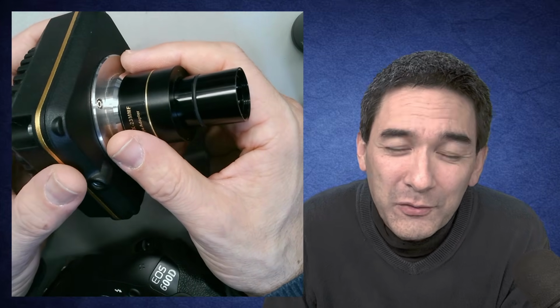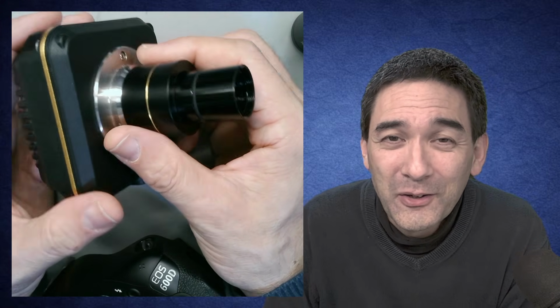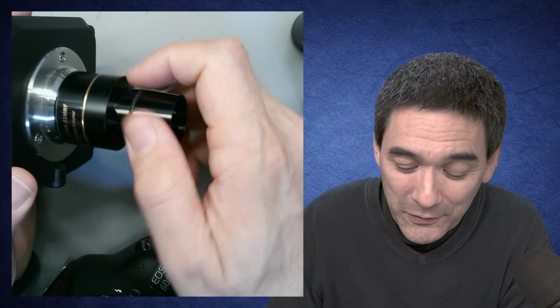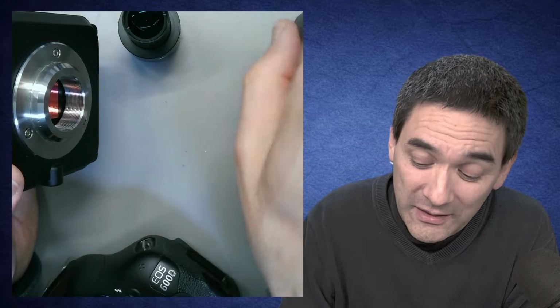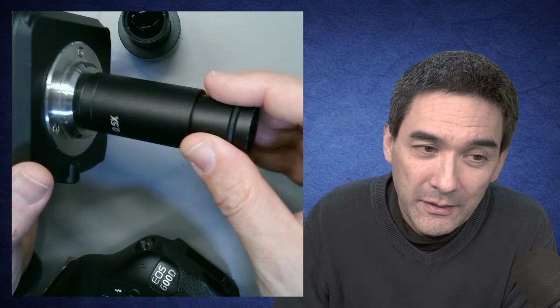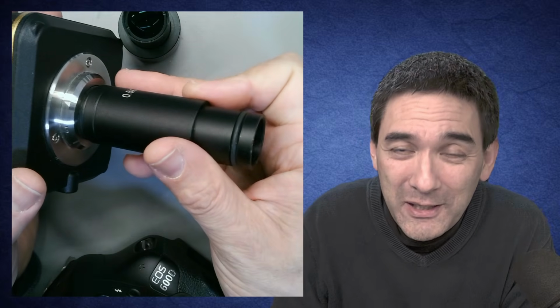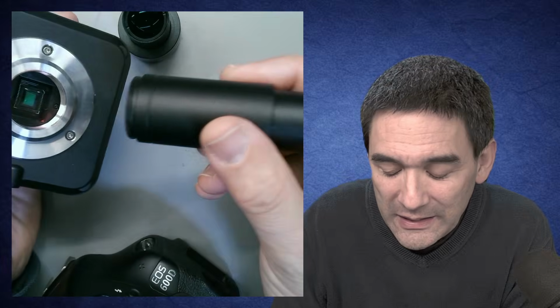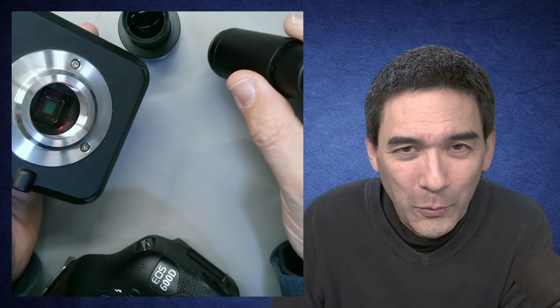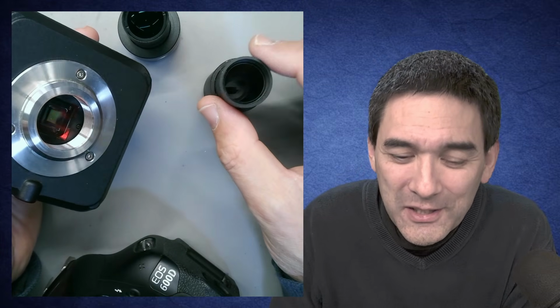Connecting cameras to a microscope is a little bit of a science sometimes, because there are so many parameters and variables. For example, if I take this one here out, and I've tried these things already, and insert another one, even though it has the same magnification, then sometimes I'm not getting a sharp image. So there is a little bit of trial and error involved, and I think that those parts are not always as standardized as I hope them to be. So there is a little bit of experimentation still necessary.